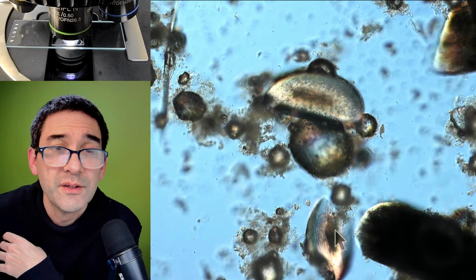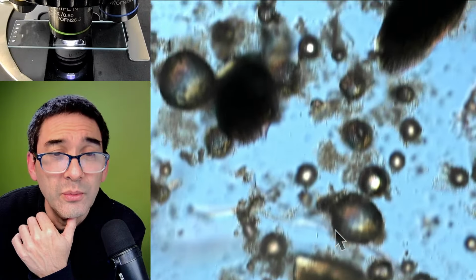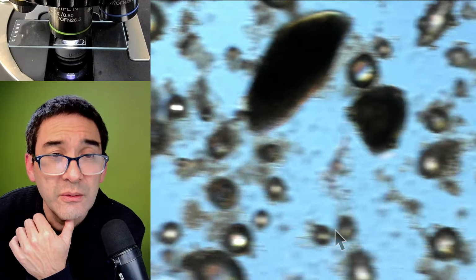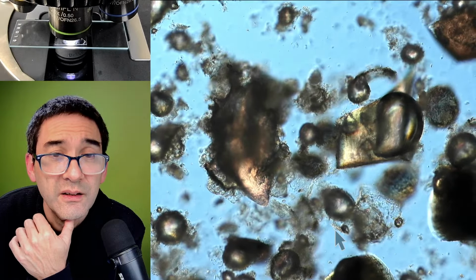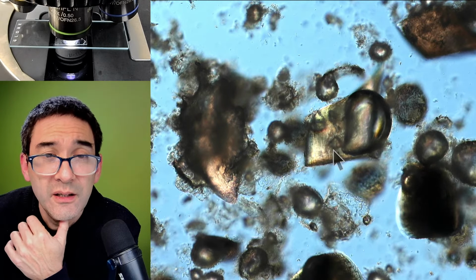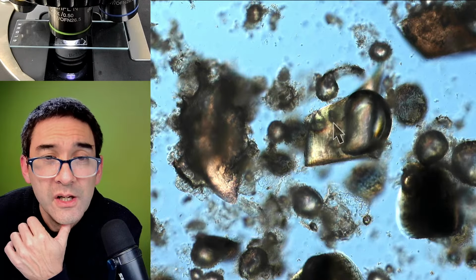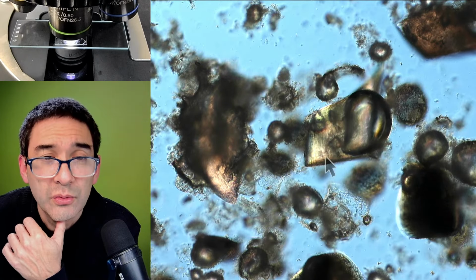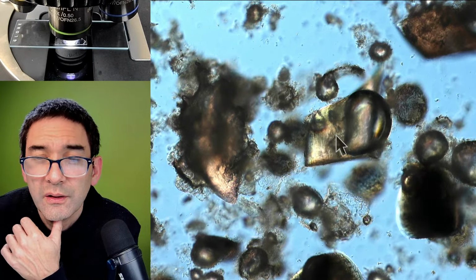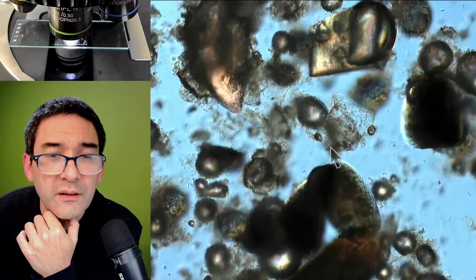And this is interesting in the sense that if I shave myself, I don't know, once a day in 24 hours, theoretically I can then calculate the average size of hair growth. So basically, this is what I shaved off from here to here, and see it's a little bit diagonal. So maybe this is approximately the hair growth in 24 hours. Okay. Yeah. So that is the thing.